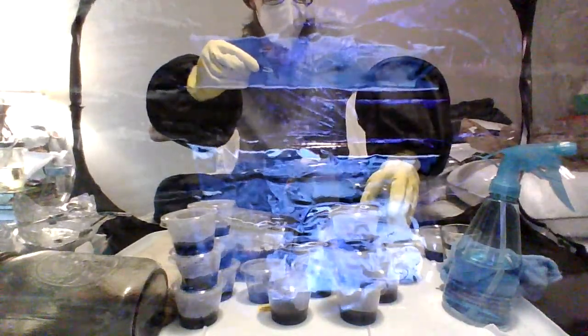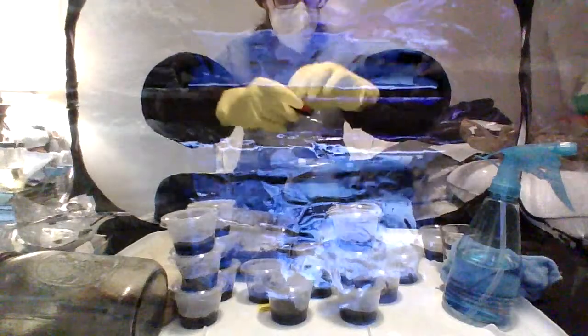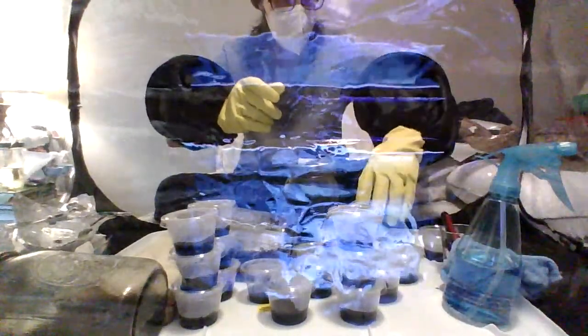Oh no. I can't believe I just dropped my sample trying to get that lid back on there. It's alright, we'll get another one. If you think it's hard to grab stuff with tweezers, it's a lot harder to use scissors. That's why I have two different tools. Alright, now that's in the bottom of there. Put these into the shot glass with the rubbing alcohol.